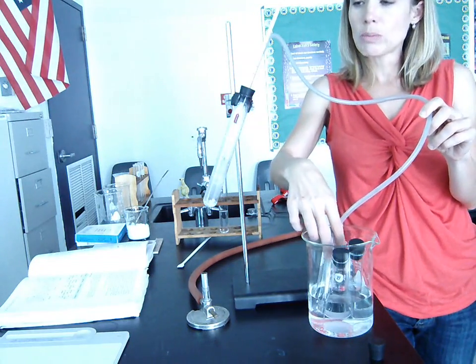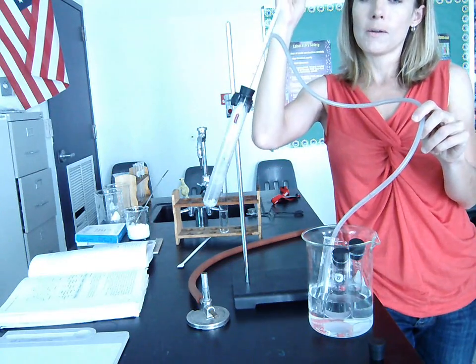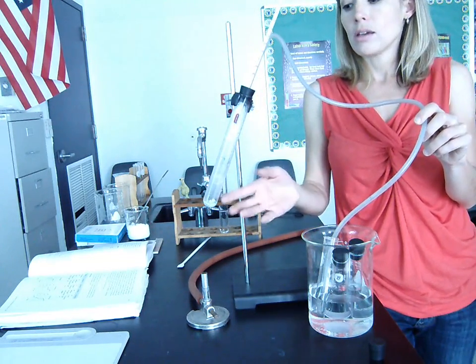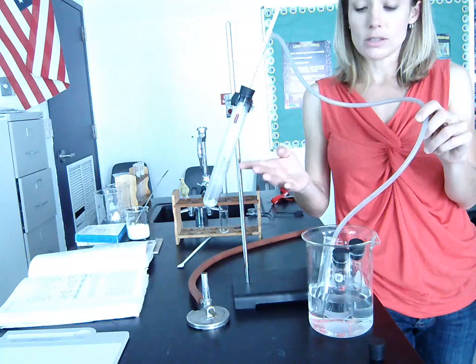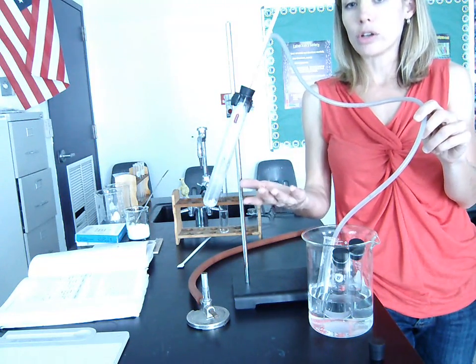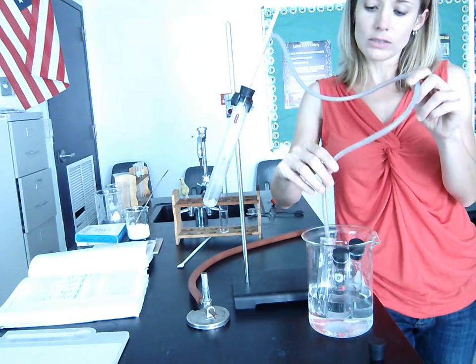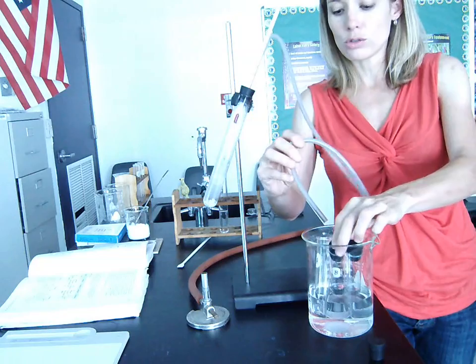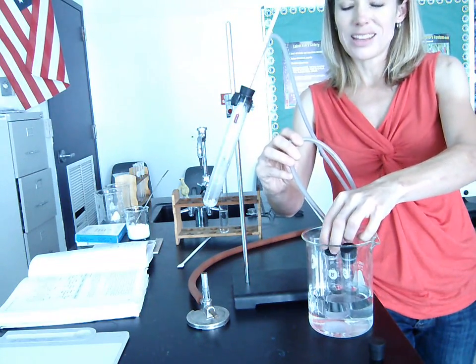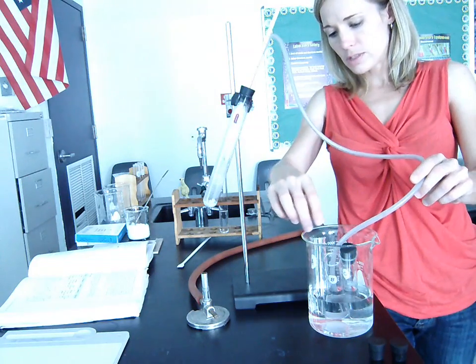Now, as we're keeping a close eye on the temperature, as soon as we start to see the temperature go up again, that indicates that all of our first substance whose boiling point is 80 has boiled off. Now the temperature can continue to go up again. So then we take the delivery tube and we move it to test tube B. And I think the book labels them 1, 2, and 3. I labeled them A, B, and C, but it's the same difference.